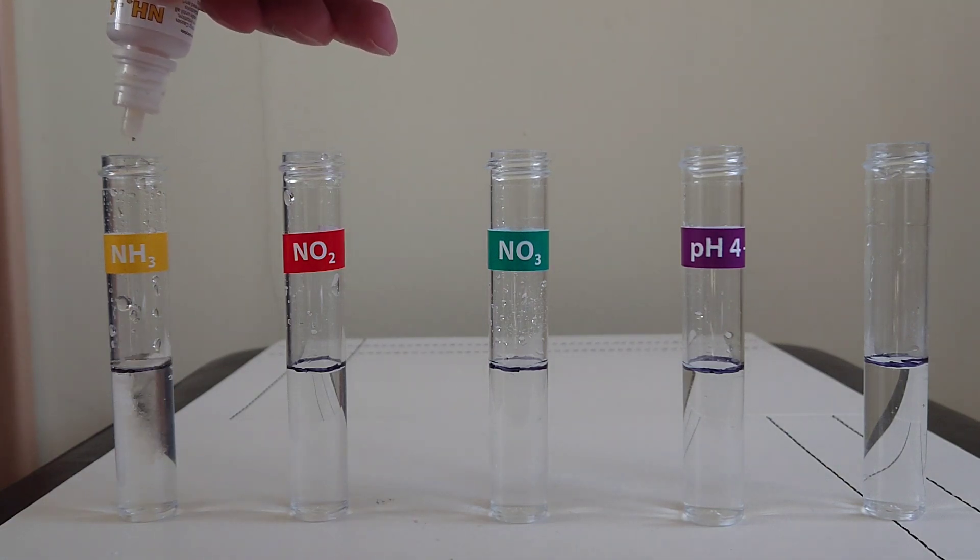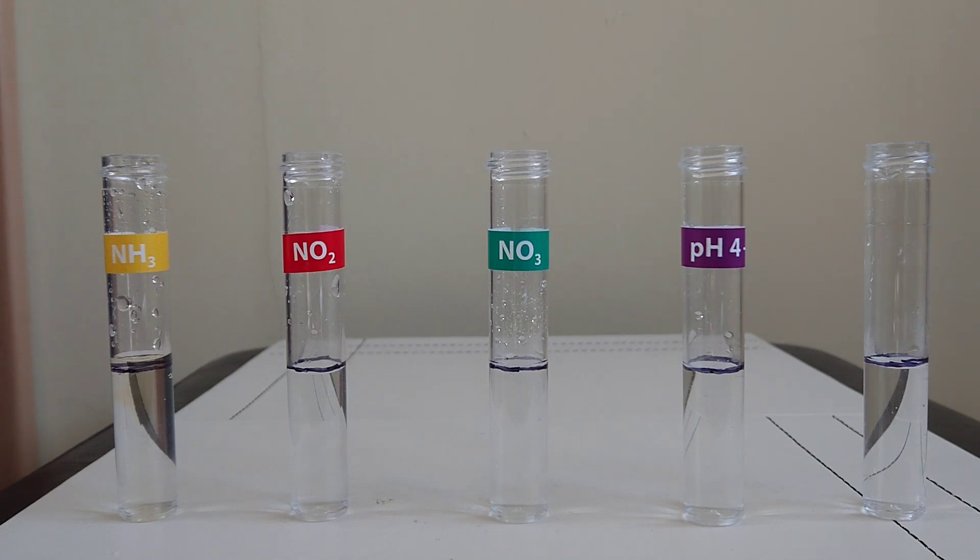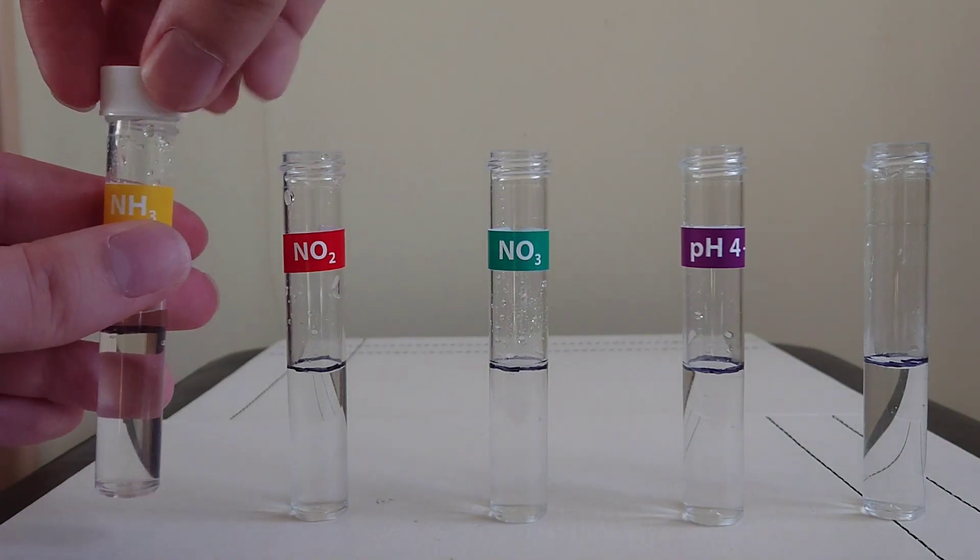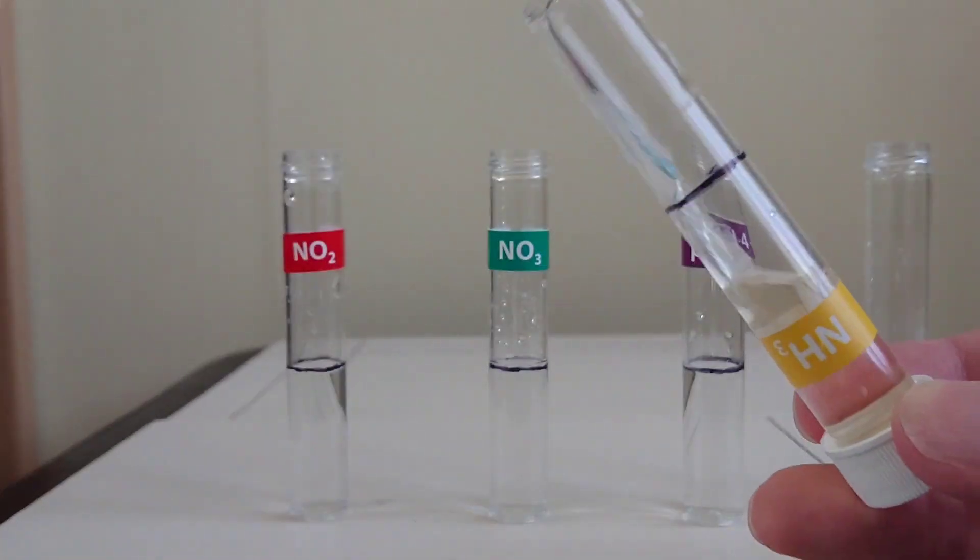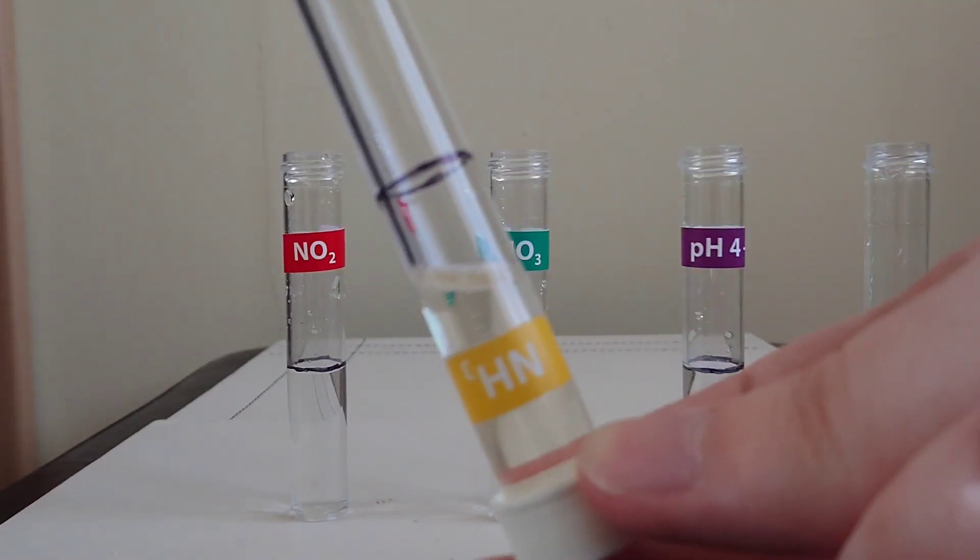Adding five drops from each of the three bottles. Screw on the cap, turn it about, give it a little bit of a shake.